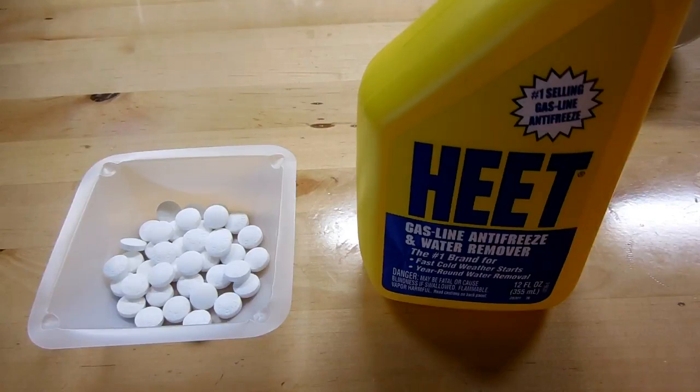Merry Christmas YouTube! For today's video I thought it would be nice to do a winter themed video by making methyl salicylate, also known as oil of wintergreen, and to do that I'm going to start with aspirin.